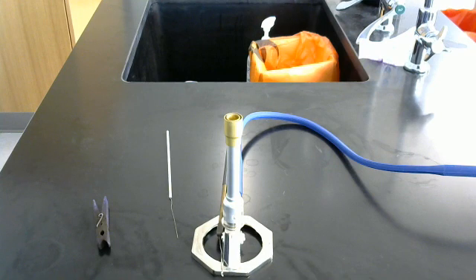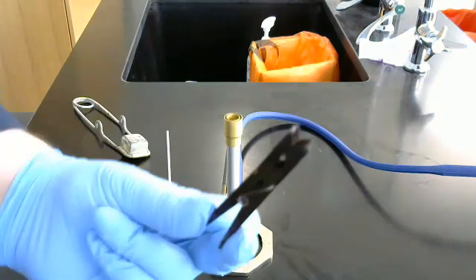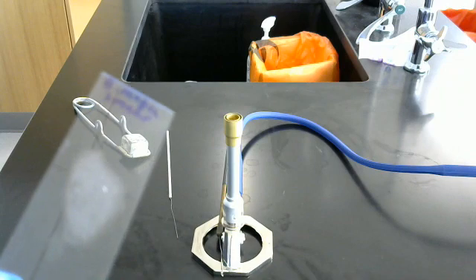Now, heat fixing is a means by which we adhere the bacteria to the slide and fix it. That's what the term heat fixing means is to affix. So what we're going to need, we're going to need one of these and our bacteria slide.